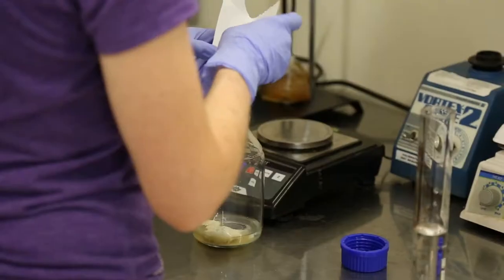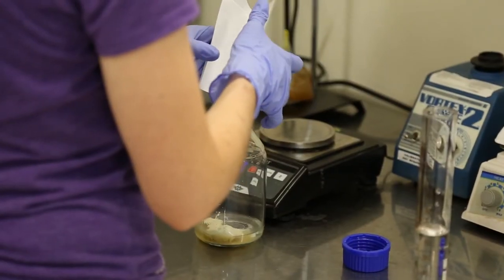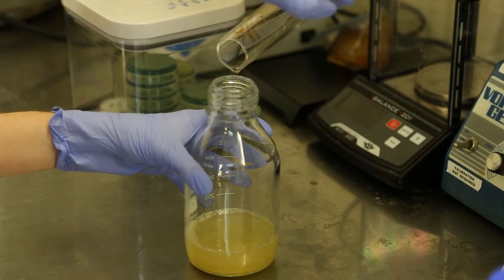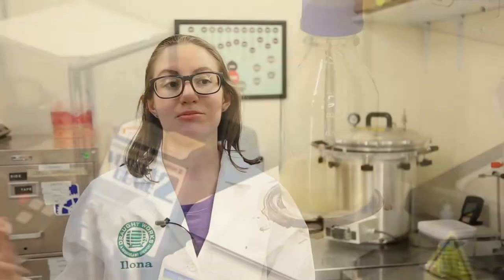We isolate microbes using a variety of techniques, including selective and differential medias, such as HLP and WLN, and spread plating and pour plating techniques. We will subsequently follow up and attempt to identify those microbes with techniques like gram staining or catalase testing.